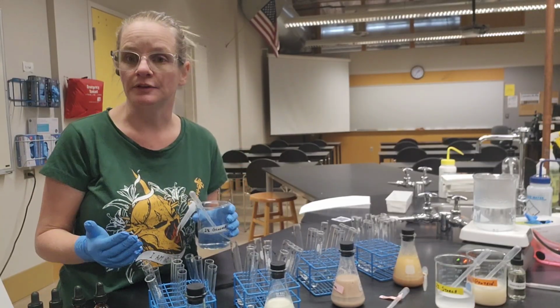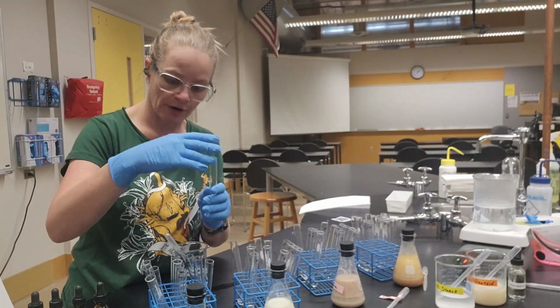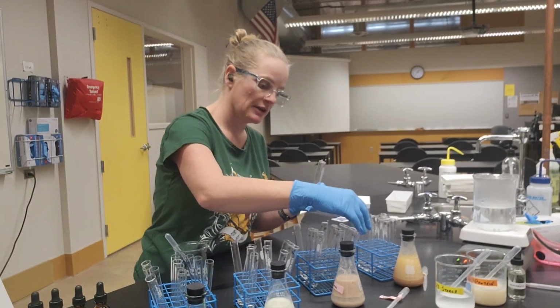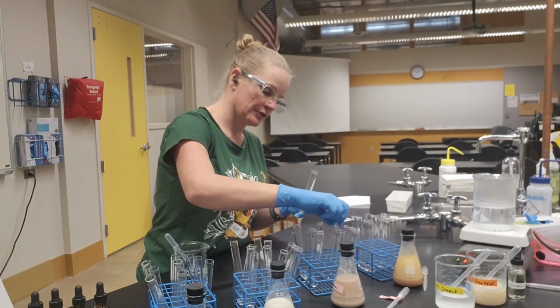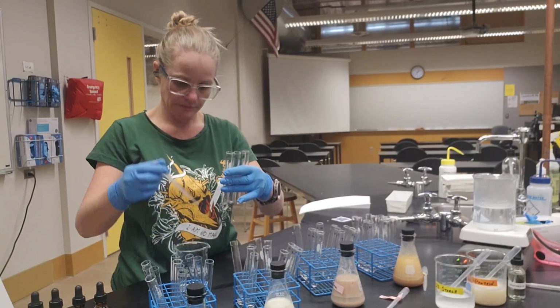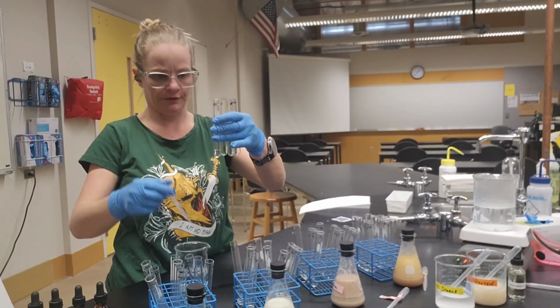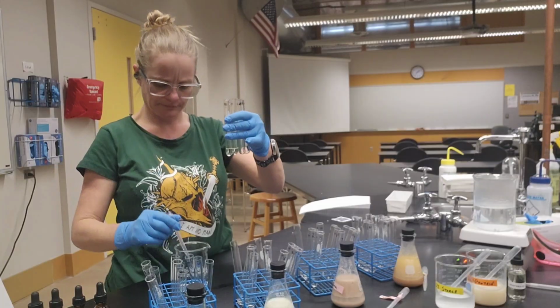So this should give us a positive result. So what I'm going to do is pull out, for all of my different foods that I'm going to test, whoopsies, just the simple sugar positive controls. That's it. And I'm going to go ahead and fill these with my glucose solution. That one was a little much. It's fine. Up to that line that I drew earlier.